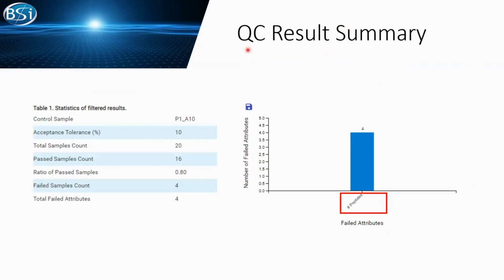We already see this sort of figure. Here is the result for this set of data. This is my control sample, and my tolerance is set to 10%. My total sample count is 20, and 16 of them pass. Pretty good ratio, over 80% passed. I still have 4 failed samples.